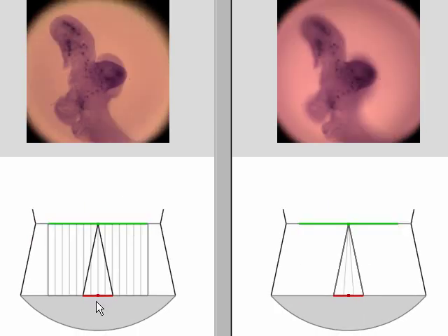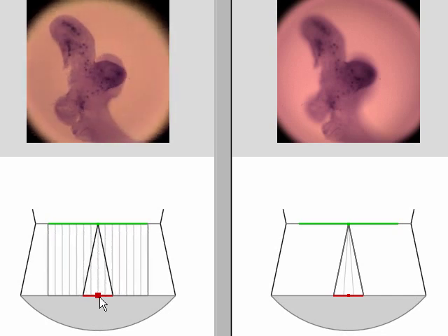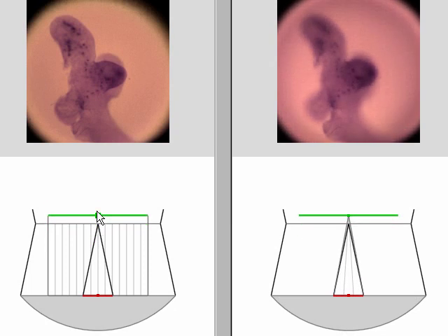In this example of an embryo mouse lung, the parallax enables us to disambiguate features that would otherwise be superimposed. And synthetic focusing lets us examine from the front of the lung to the back of the lung, a distance of about 200 microns.